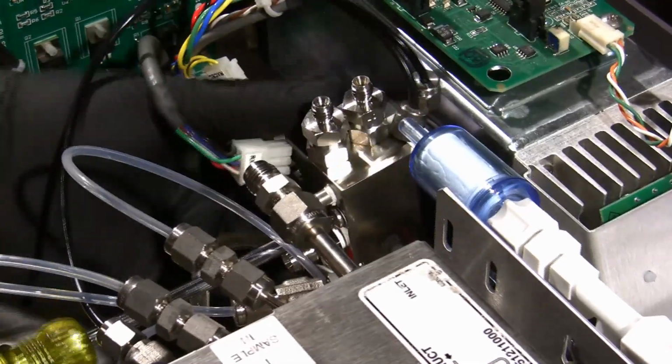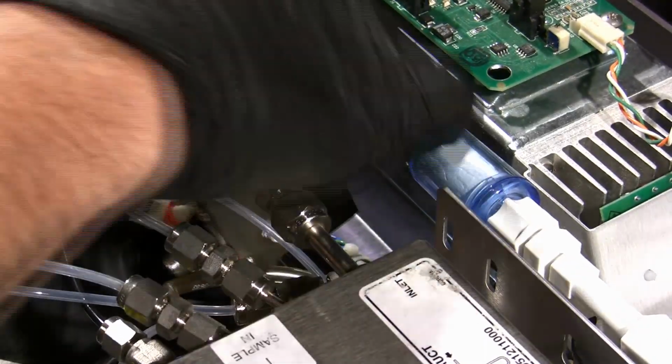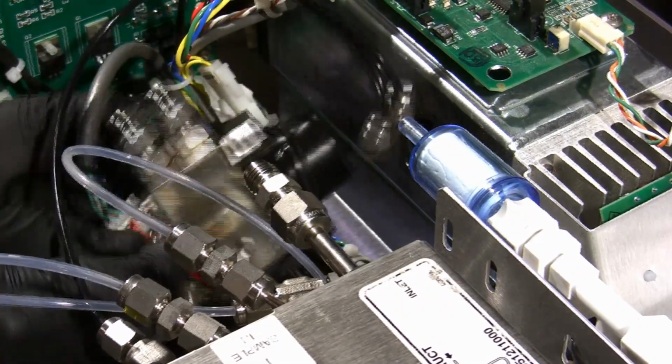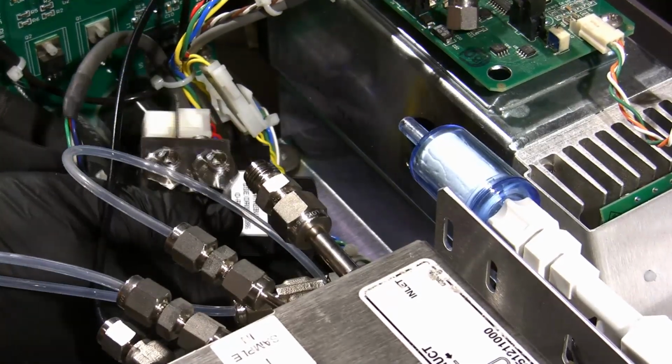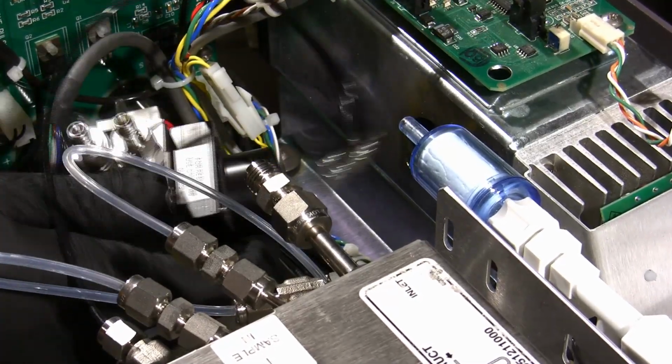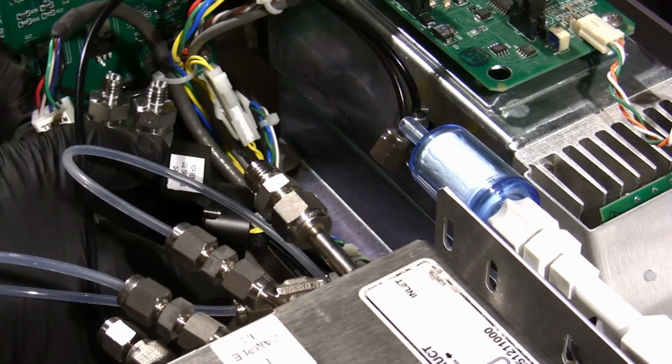So those are the 2 that pass all the way through to our PMT cooler. You'll see they're coming out there. Those will be our longest ones. So those are on the flat surface of the reaction chamber block here versus the other 2, which are a little recessed.